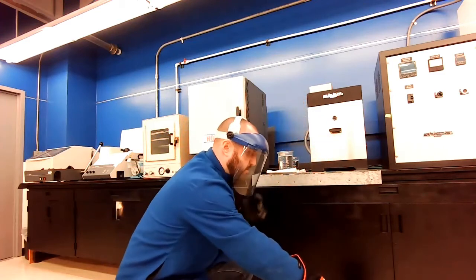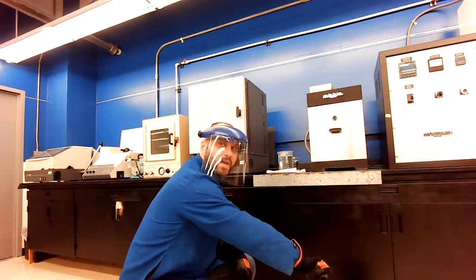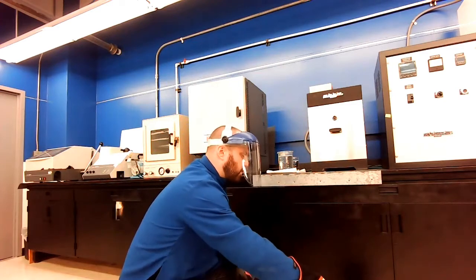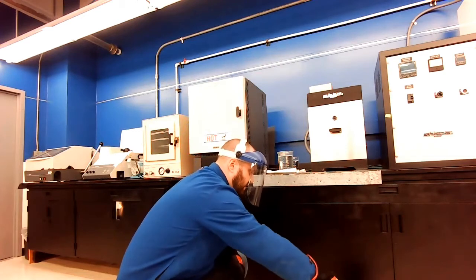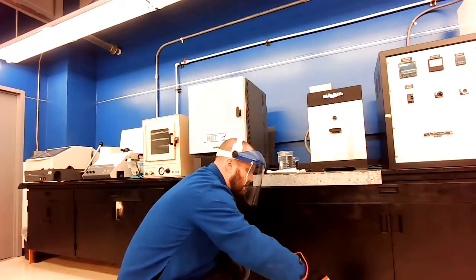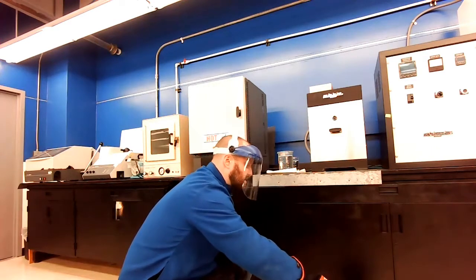So I close down the furnace again, keep everything hot. I took this sample and I'm moving around. So the salt water is keeping us from forming too many bubbles around it, as well as me shifting this around inside of this sample. So the combined effect of these two is hopefully keeping me from getting that Leidenfrost effect.